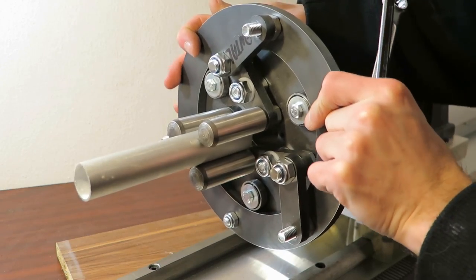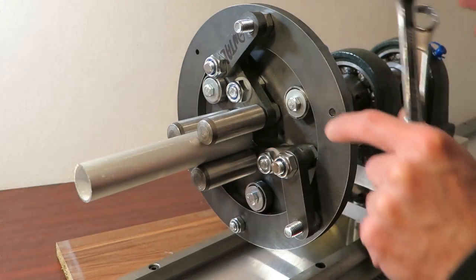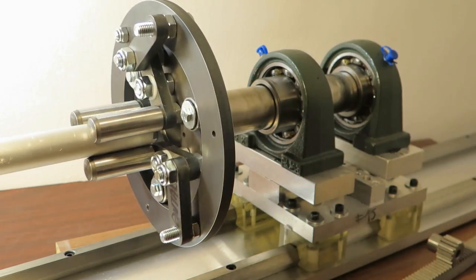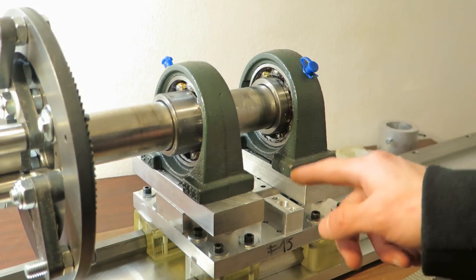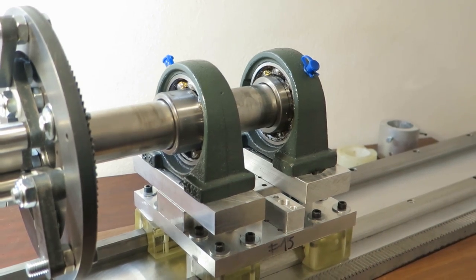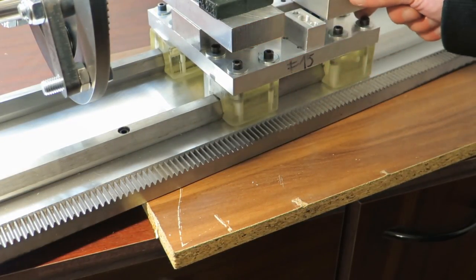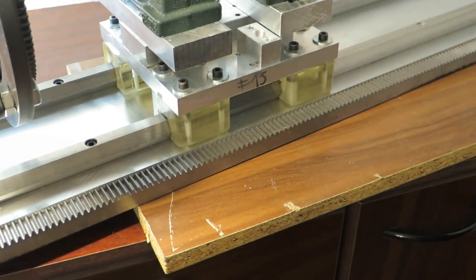Also, this chuck is not adjusted right now. I have this piece that will go on this shaft and it will hold this concentric. Right now I have the motor disassembled because I'm changing the stator. Also, I bought this thing. Oh, you can see it. Okay, sorry. And this is for moving the spindle assembly, basically.